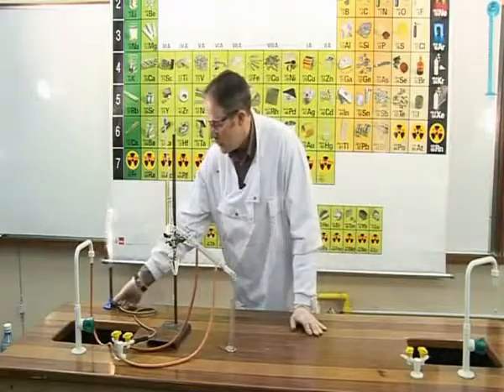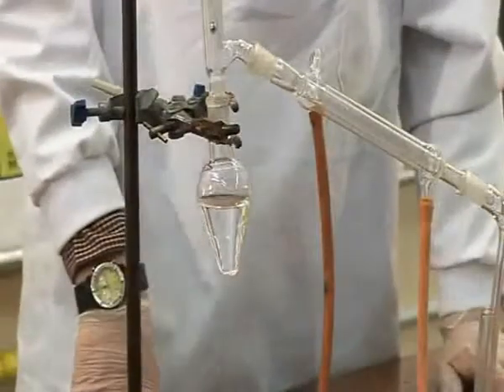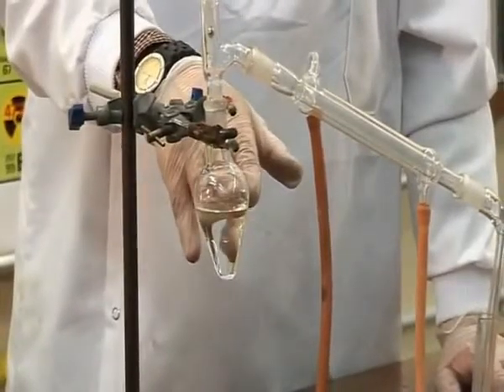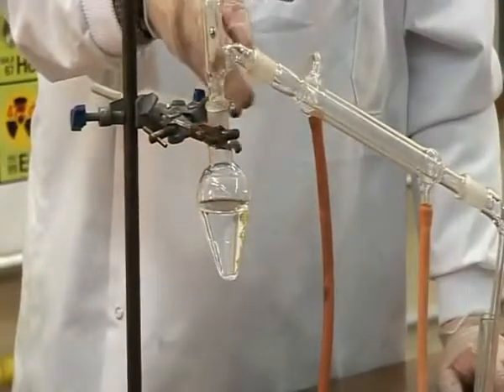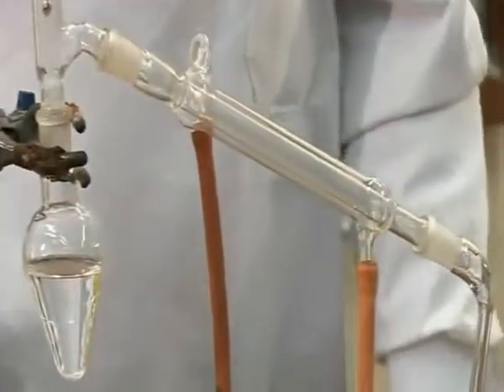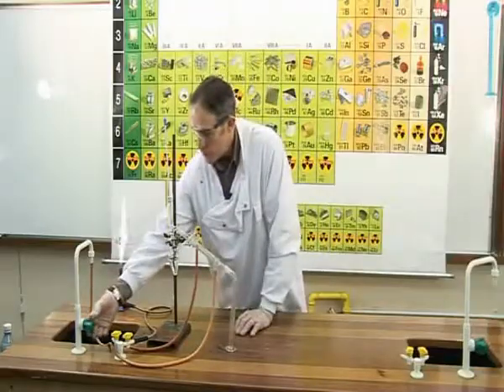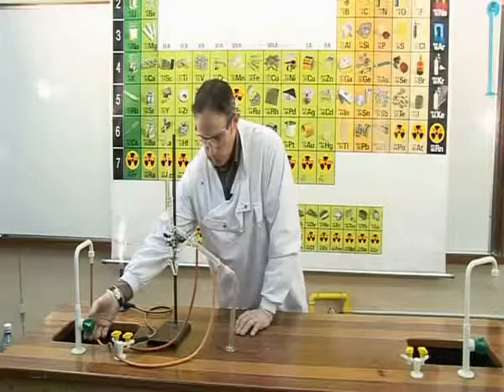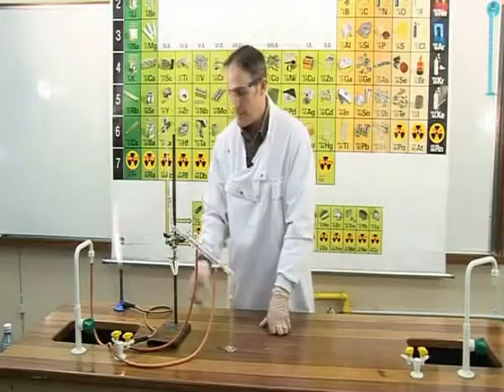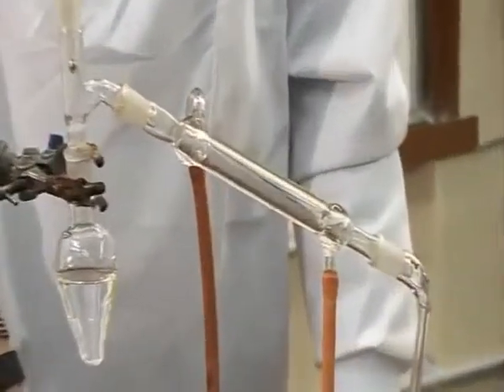What we're going to do is heat the flask, and the alcohol will boil at 78 to 80 degrees. The alcohol will change state from a liquid to a gas, and it will travel up the tubing and down through this pipe here, which is known as a condenser. So before we start, it is important that we switch on the condenser, which simply involves turning on the tap, and the water will flow in the bottom, up through the condenser and back to the sink. This flow of water ensures that the condenser is kept cool throughout the experiment.